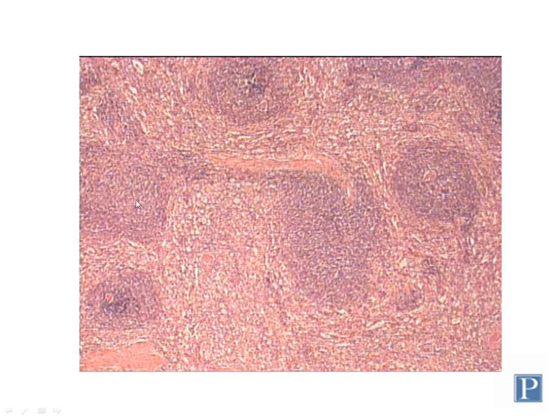Here's a lymphoid nodule consisting of B cells. Here's another one here. Here is a periarterial sheath consisting of T cells. Notice that in cross-section, the periarterial lymphatic sheath may look a lot like a lymphoid nodule, because now you're seeing the artery in cross-section, and this is the sheath surrounding it. So it kind of looks like this structure, but because you can see the artery in the middle of it, you know this is a periarterial lymphatic sheath in cross-section, not a lymphoid nodule. Here's another example here.